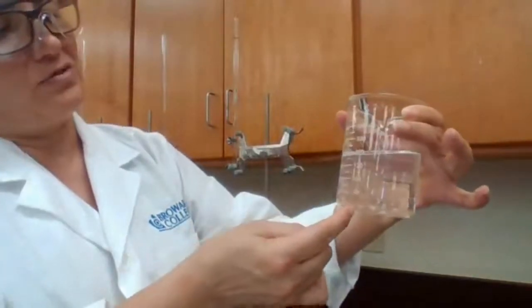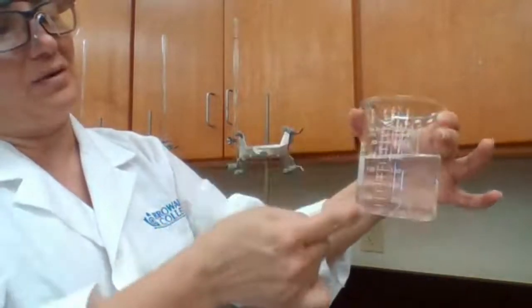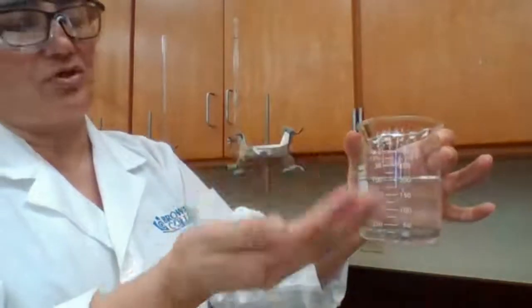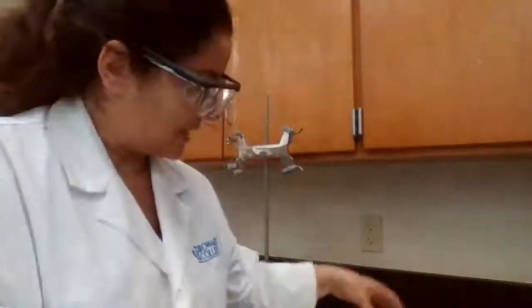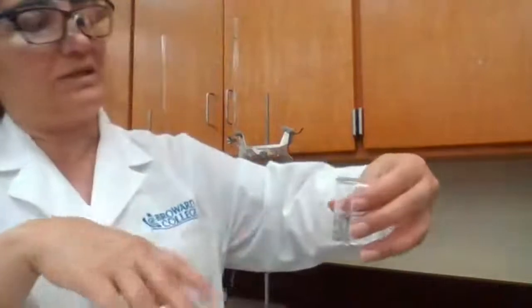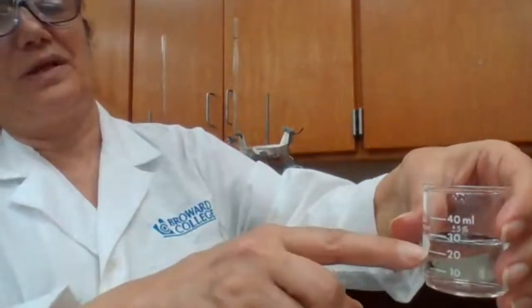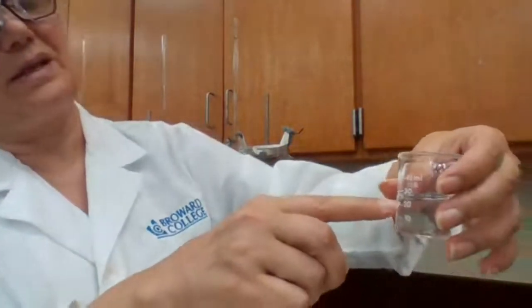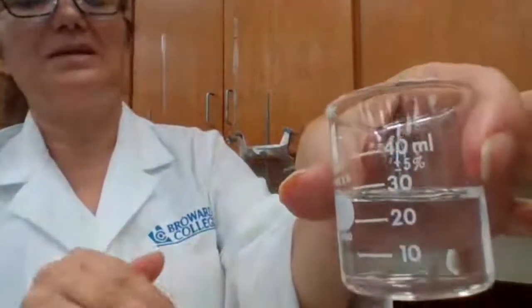The numbers are graduated, going up on the right side and going down on the left side. So you can say approximately how much you're taking out, or how much liquid is in the beaker. So for the data sheet, for station 6, the level of the liquid is between 20 and 30. It's closer to 30, so I can say it's about 28, but the 8 is the estimated number.